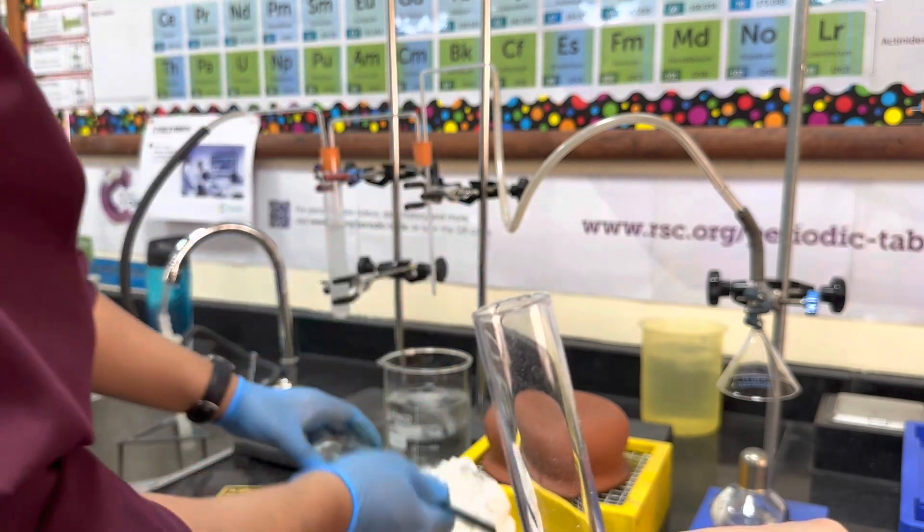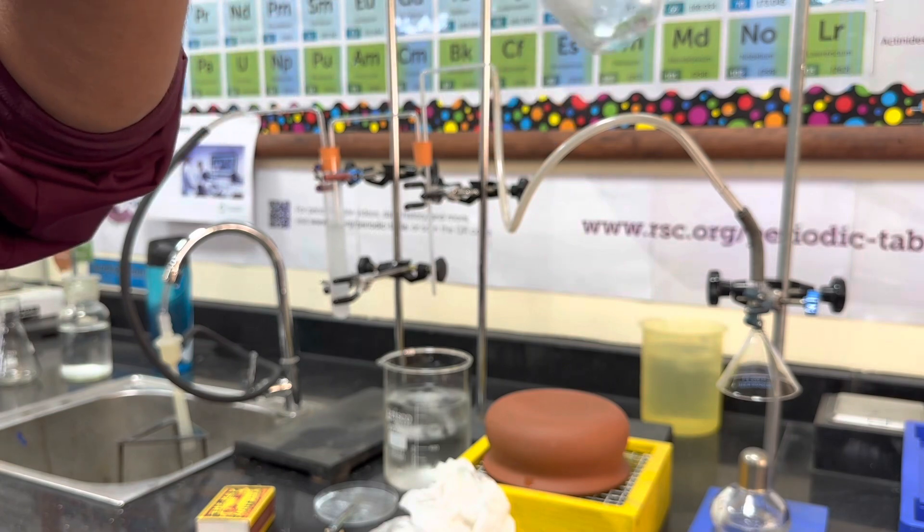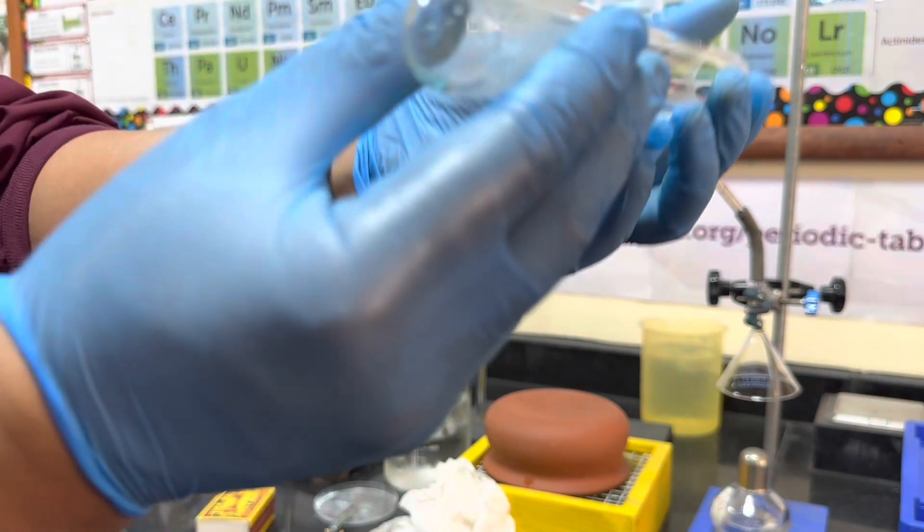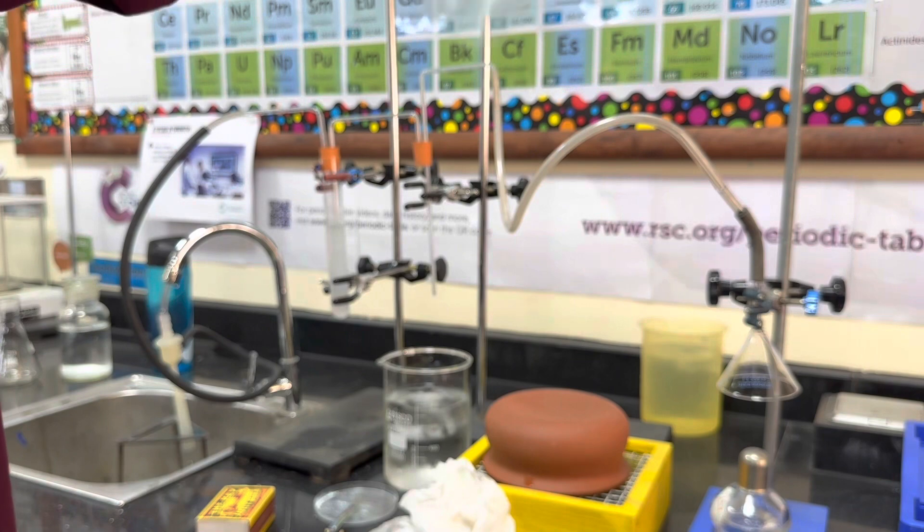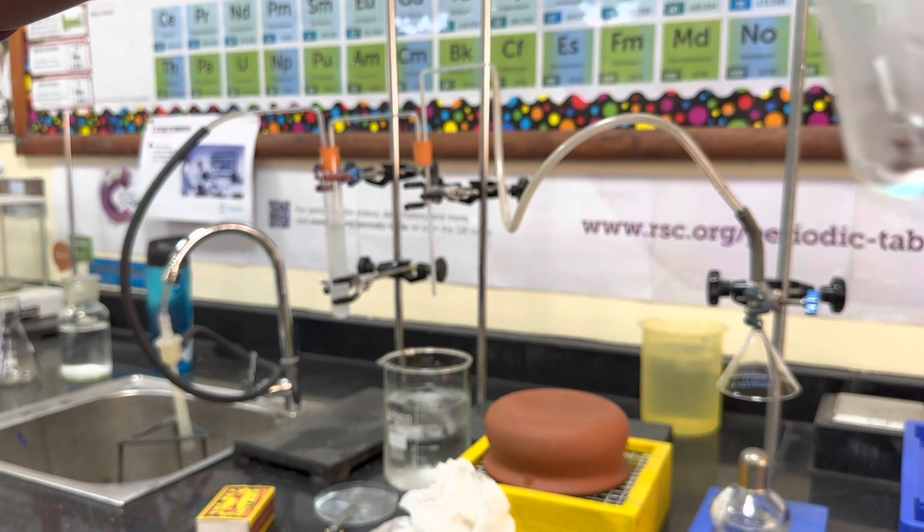That will be confirmed by a color change - it should go from white to blue. Just give it a little bit of a shake to make sure that the powder goes to the bottom, and you should now be able to see the blue color forming at the bottom. That confirms water is present.